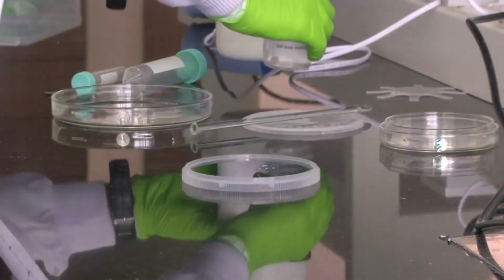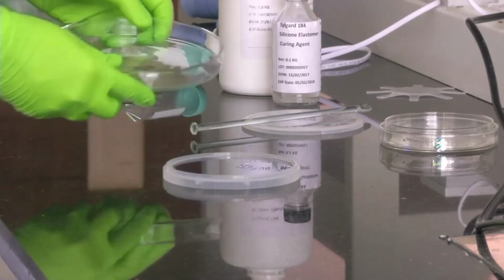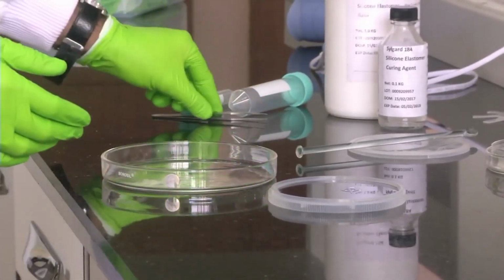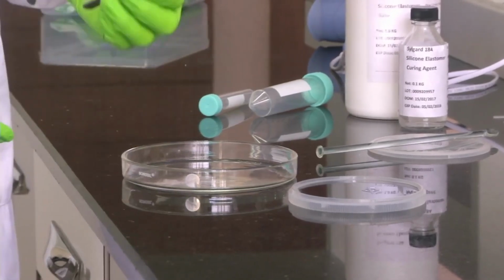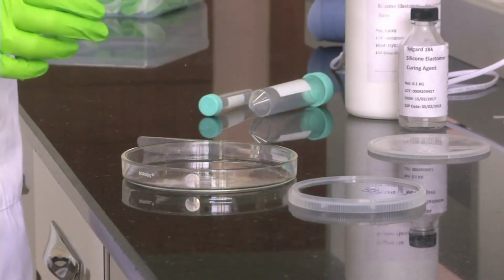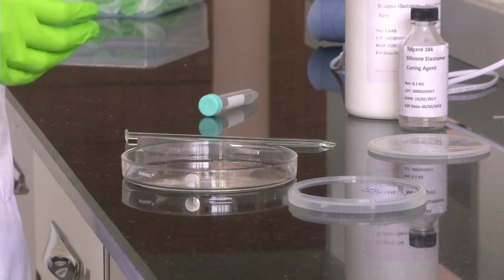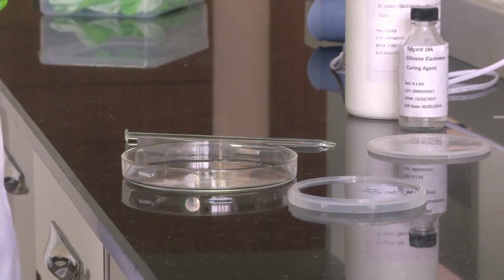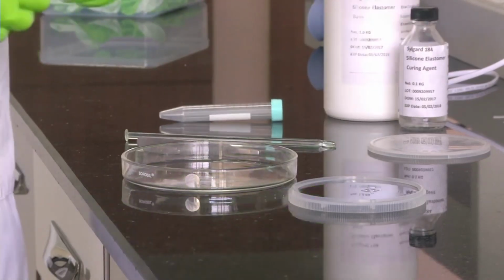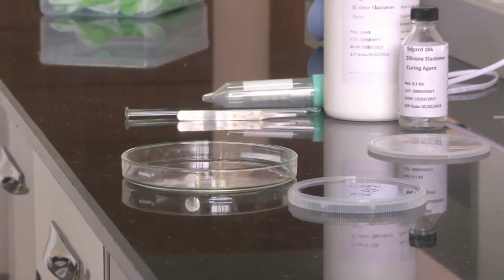So, what all equipment do we have? We have our silicon master, which is in a wafer carrier. We have a 135 mm glass petri dish where we will keep our silicon master. We have a SS or stainless steel tweezer to handle our wafer. We have a stirrer. This stirrer is used to thoroughly mix the PDMS and the curing agent. We have a 50 ml tube where we can mix the PDMS and the curing agent before we pour it onto the petri dish. And we also have a 15 ml tube in case we need it during the process. And obviously, we have the PDMS and the curing agent with us. So, these are the major things that we need for doing this experiment. At the end of the experiment, you will be able to see a PDMS membrane clearly getting formed.